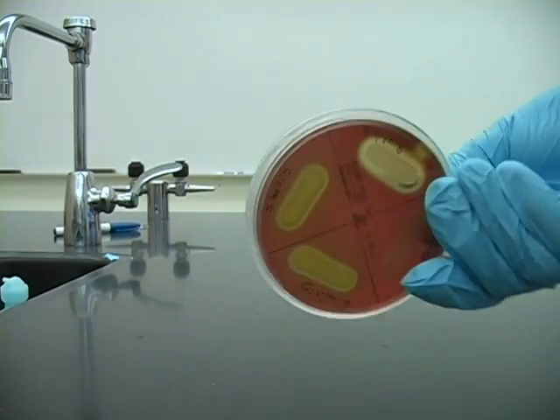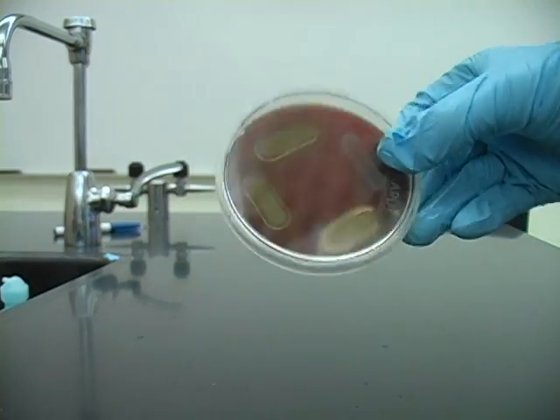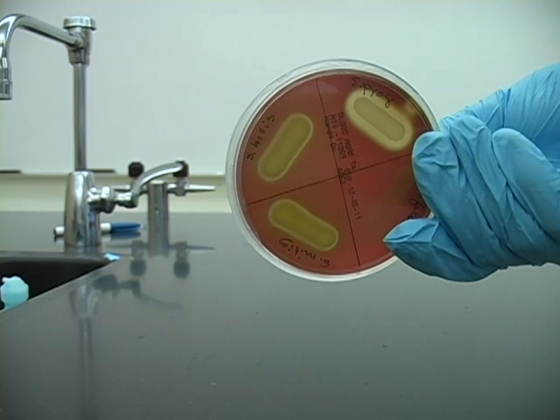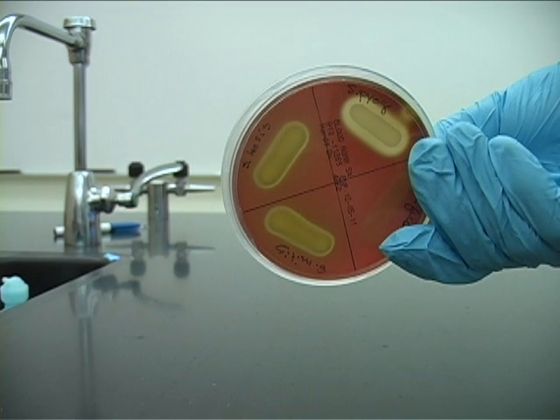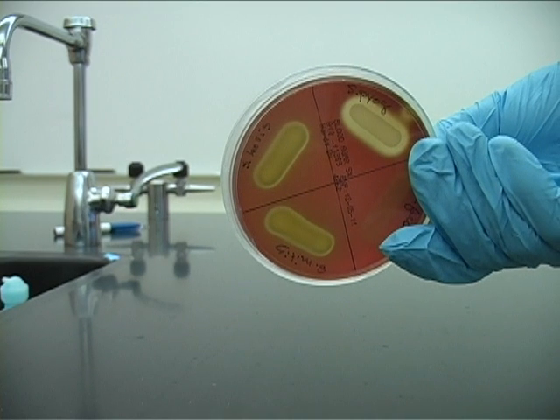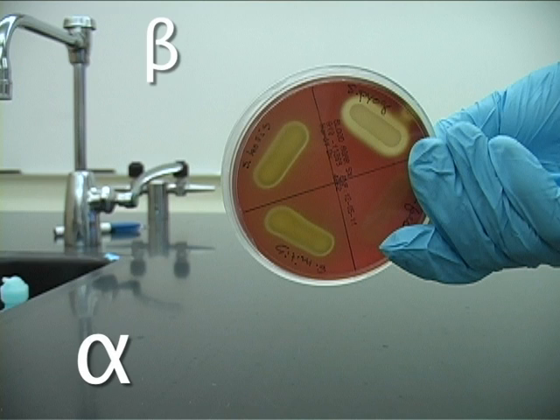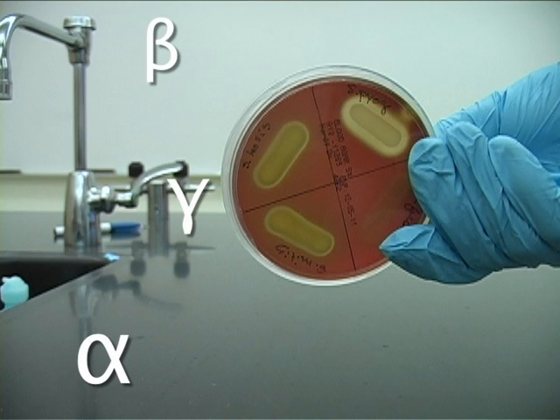Pay attention to the growth near my hand. See the difference? It's there. Now that you know how to pick out hemolysis visually, let's talk about alpha, beta, and gamma hemolysis.